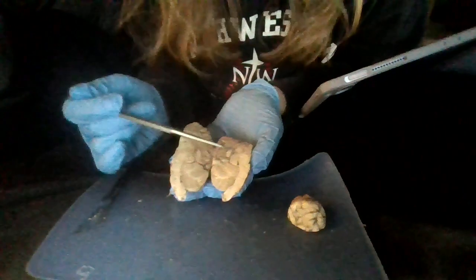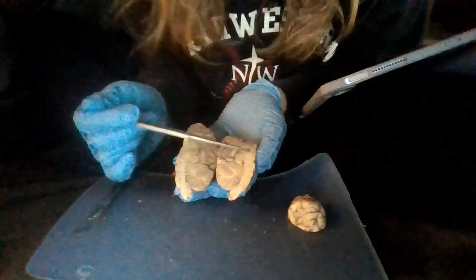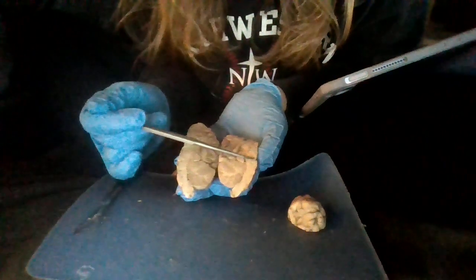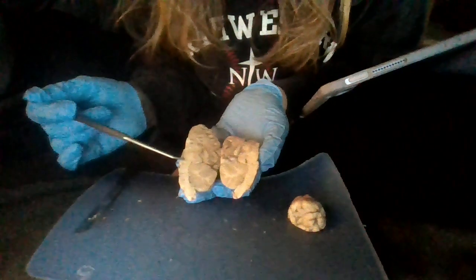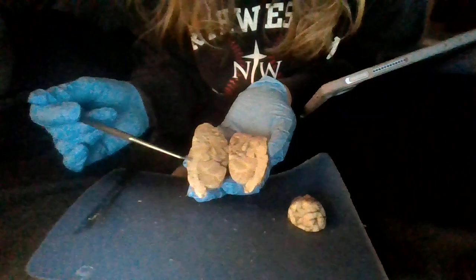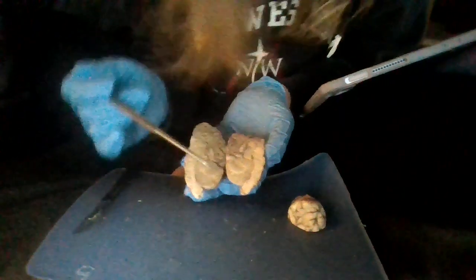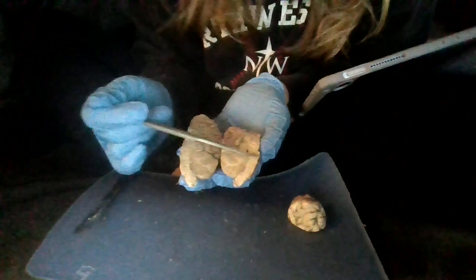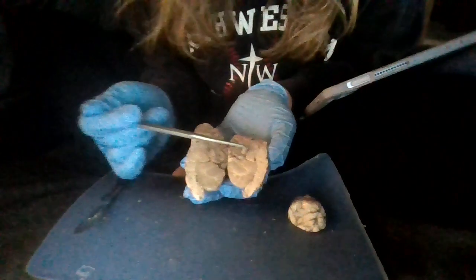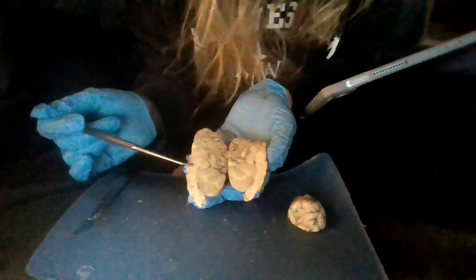And then our pons is going to be kind of right in here, I want to say, because it's going to be farther up than our cerebellum where it starts. So it's going to be right in here, I believe, on the bottom part though, not the top part. And then we're going to have our midbrain, which is going to be in here. It's going to be even a little higher up.